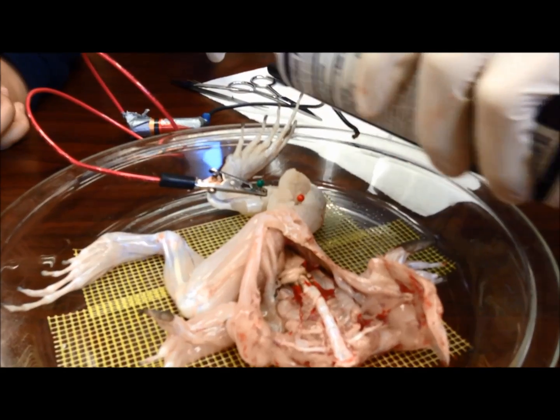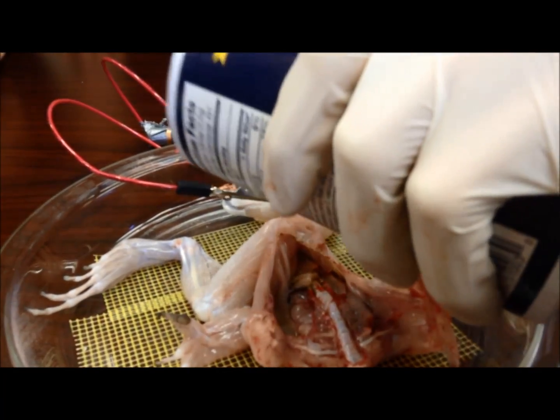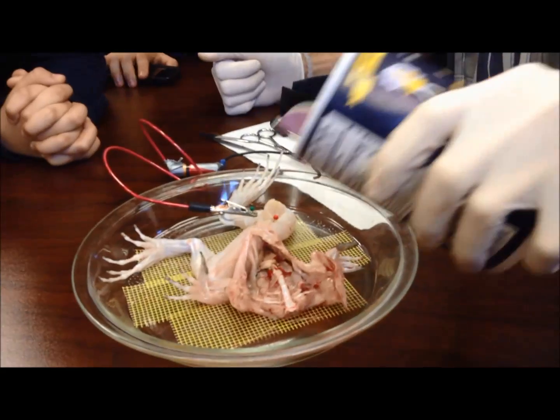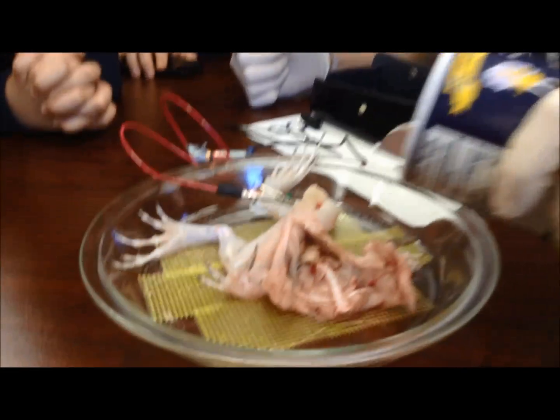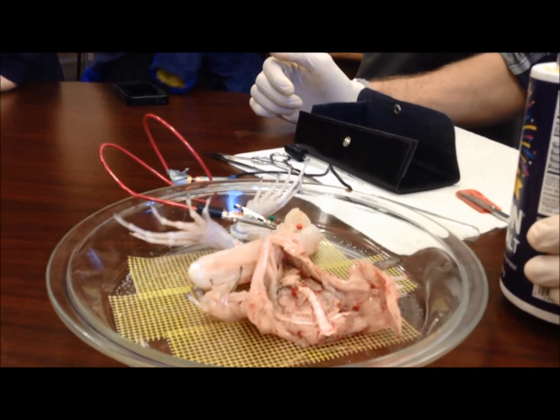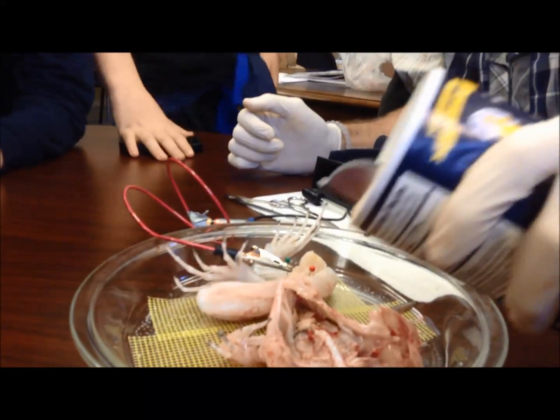It's moving! The other side — the other leg. There is a leg. Oh my god! It's so easy! His hand moved — Oh! Oh god! It's missing a head though! Oh, it's dancing!